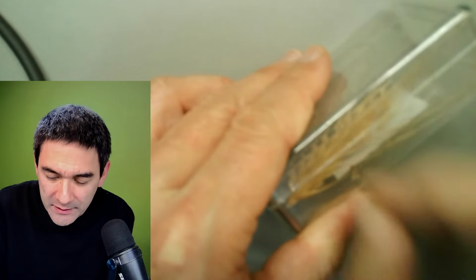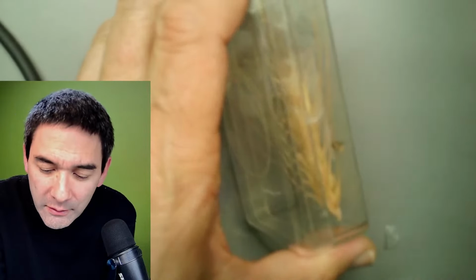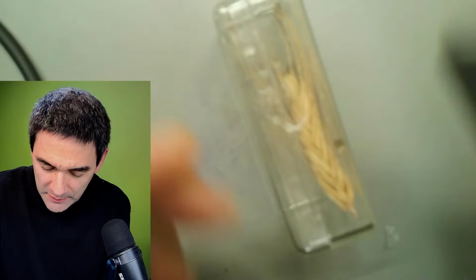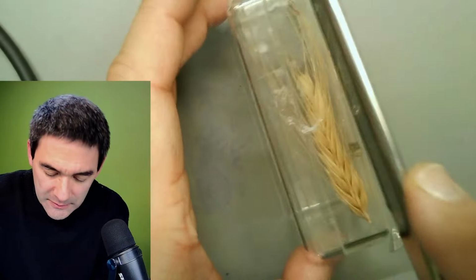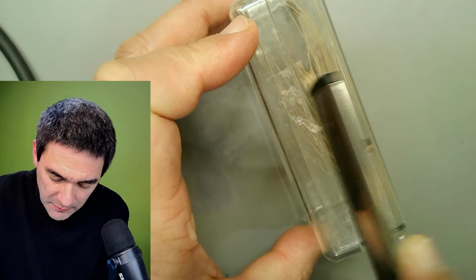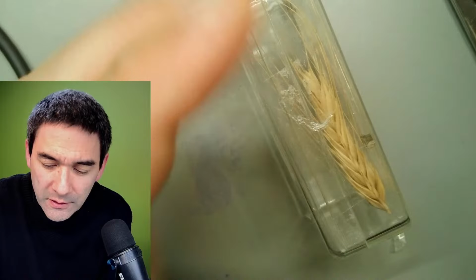And I cannot open it. It doesn't matter. No, I can open it. Where is this thing? I'm going to use my dangerous razor blade. I'm going to open it here again. No, I can't because it's protected. I have to use a different technique here.